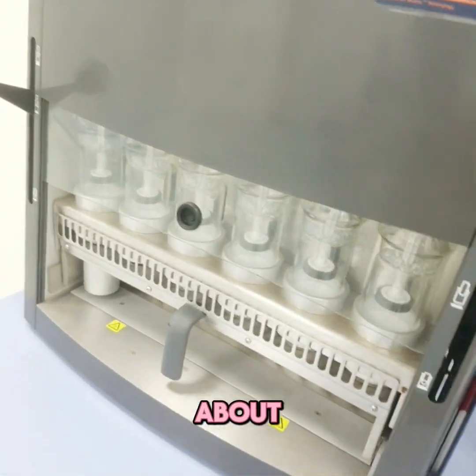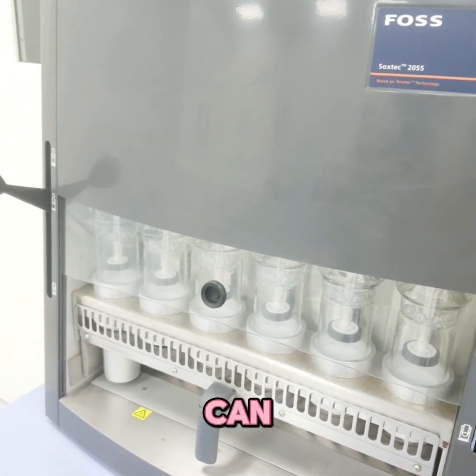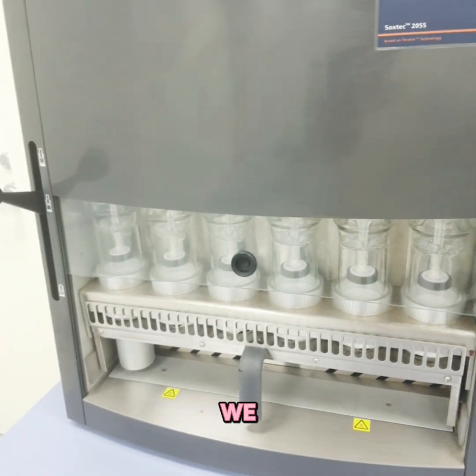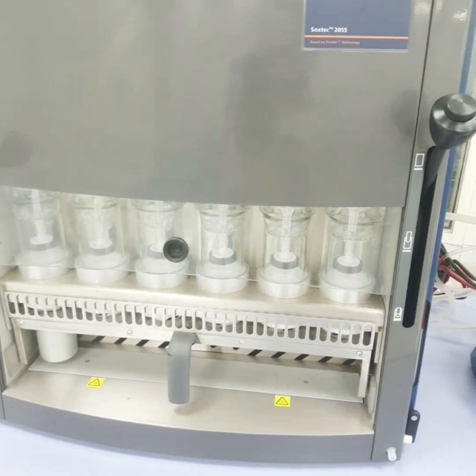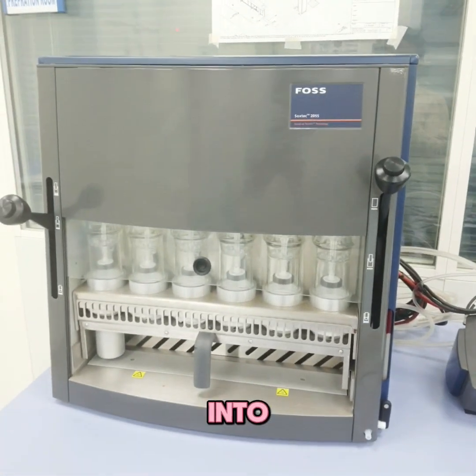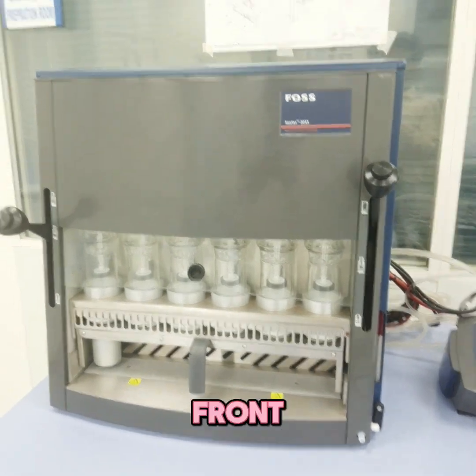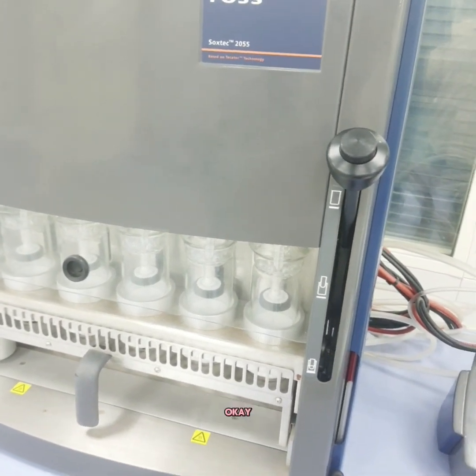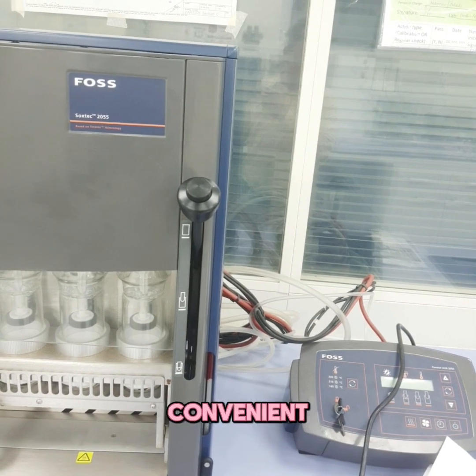Today we are going to talk about solvent extraction, also called fat or oil extraction from solid samples. In the first part we'll talk about the equipment used for extraction of oil or fat from solid substances. In front of us we have a device called the Soxtec system, which is an extraction system used for convenient and economical determination of soluble or extractable matter.